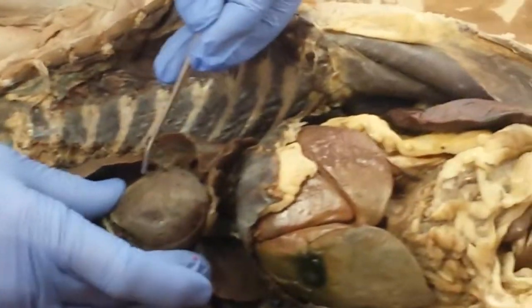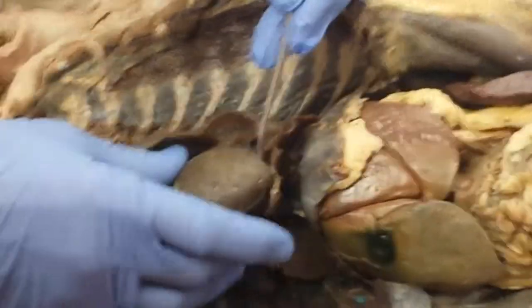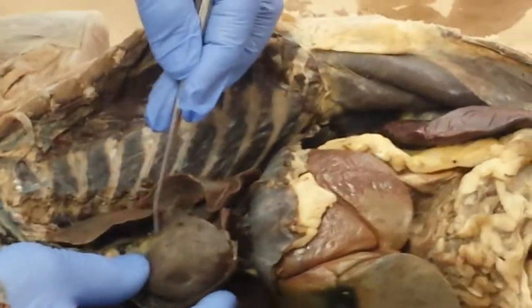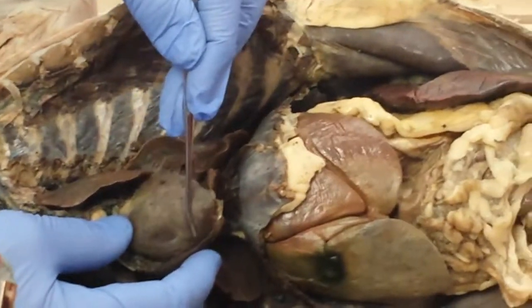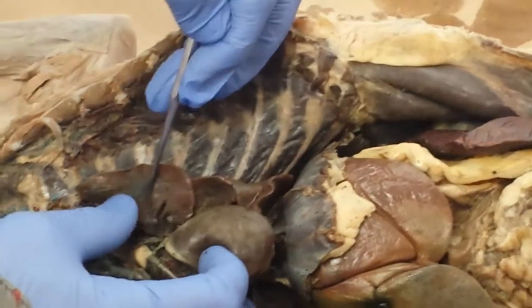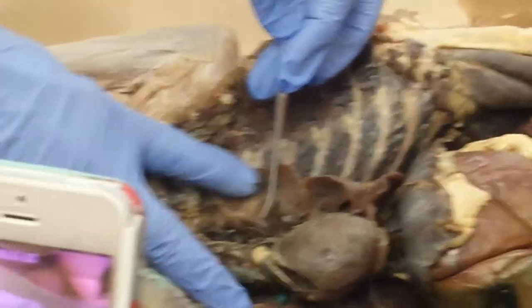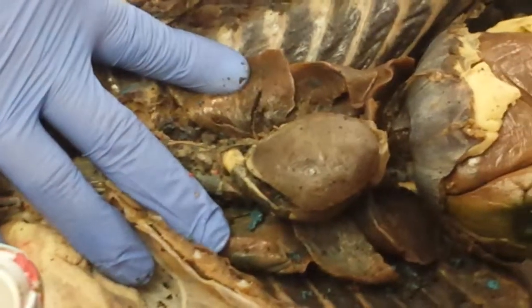Unfortunately, we don't have a real prominent anterior interventricular or left anterior descending coronary artery. But based on experience, I would expect that it would be right in this region right here. So that would tell us that this side is the right ventricle, this side is the left ventricle. Apex, base. So the first thing you're going to look for are the atria. Right atrium, left atrium. Notice the right atrium's a little more exposed than the left because the heart's rolled a little bit.